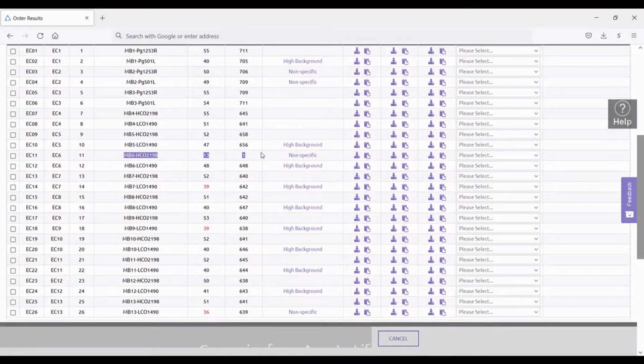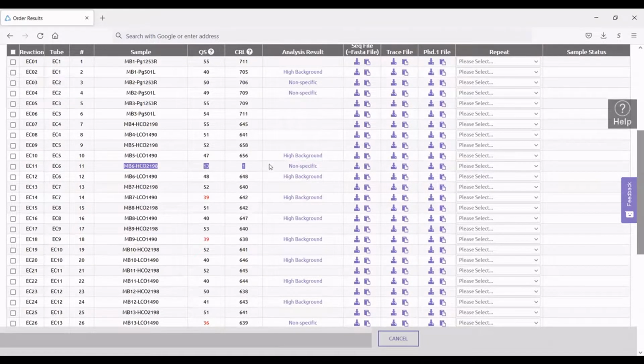So for instance, this individual that I had here, this is the ID number that you put into the order form, paired with the primer that was run at the sequencing end. And so you can see here that this happens to be my reverse primer. These are the Folmer primers from 1994. This primer did not successfully amplify the gene that I wanted it to. In fact, there's no PCR product.